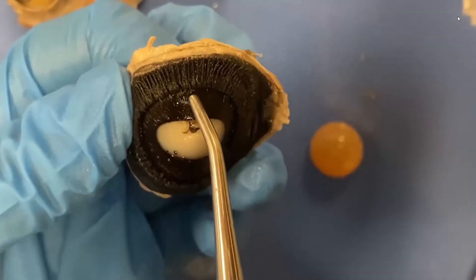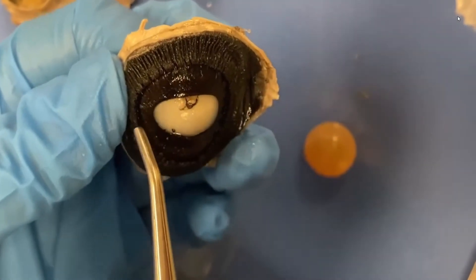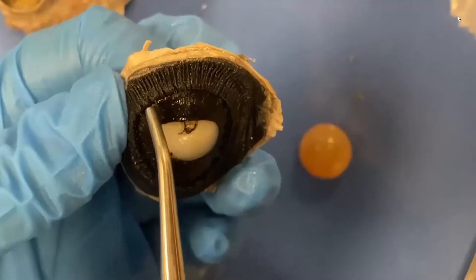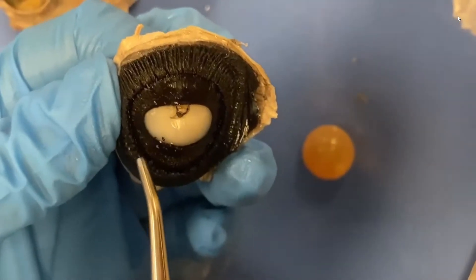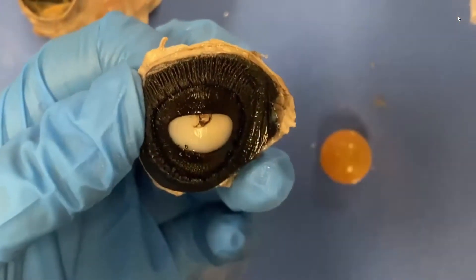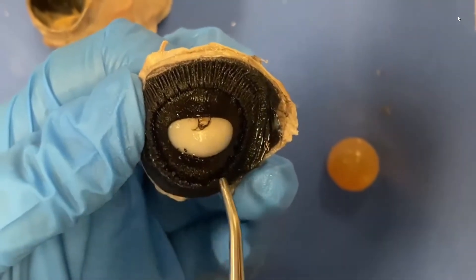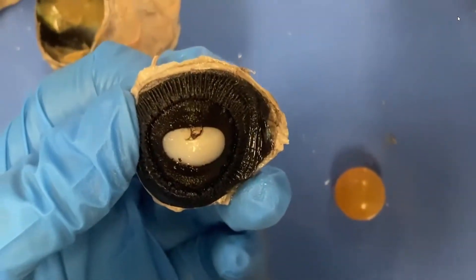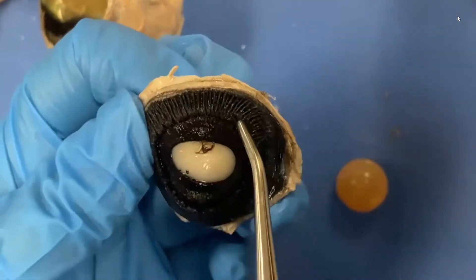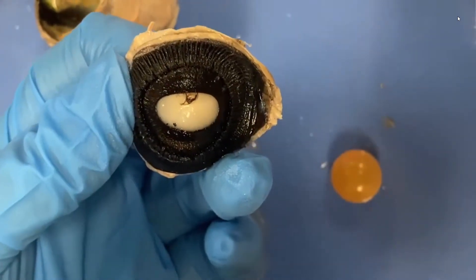And then if you look here, this is the other muscle — the little fibers are going in this direction. This is a pupil dilator muscle. That will make the pupil bigger — it'll dilate the pupil. And you can think about which part of the sympathetic — whoops, I just told you the answer — which part of the nervous system that belongs to.